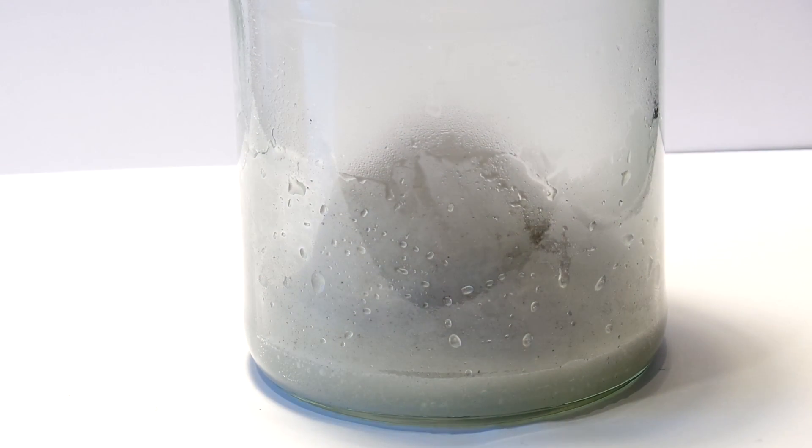The reaction goes for about 10 to 20 minutes and we are left with a green-yellow liquid and black residue, which is carbon that has been added to iron to make steel.